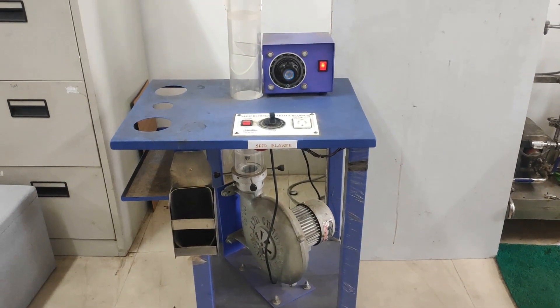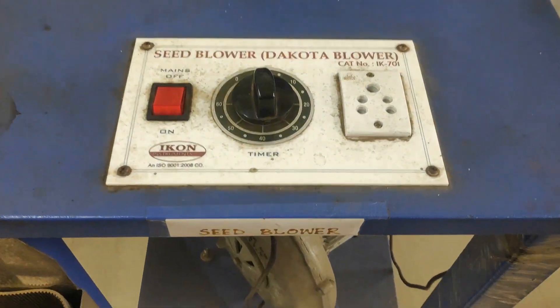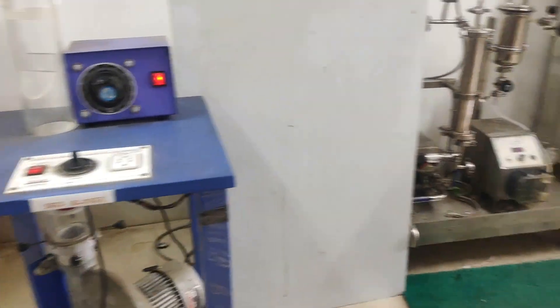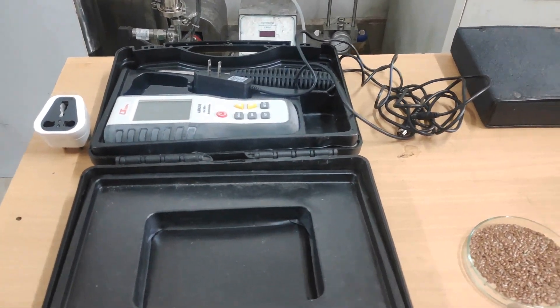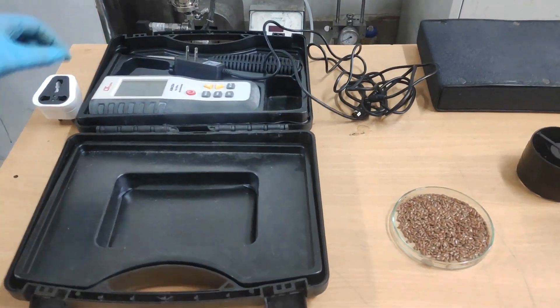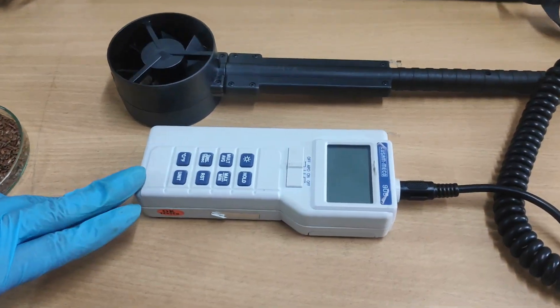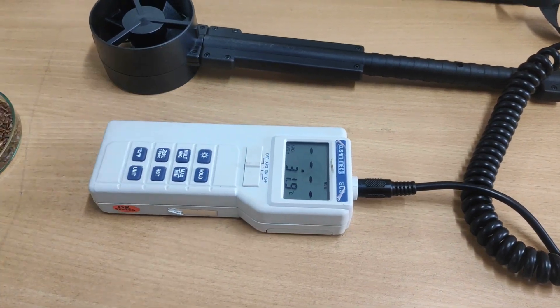The machine we are using for today's experiment is a seed blower developed by Dakota Industries, model IK701. The requisites of today's experiment are a seed blower and a hot wire anemometer. Generally there are two types of anemometer used for determination of wind velocity: the hot wire anemometer, which has a hot wire plug running on AC supply, and a second anemometer which runs on conventional battery-operated unit with a fan.